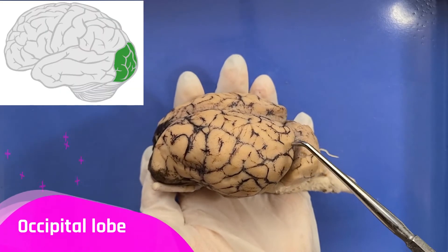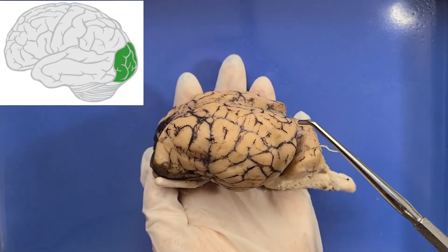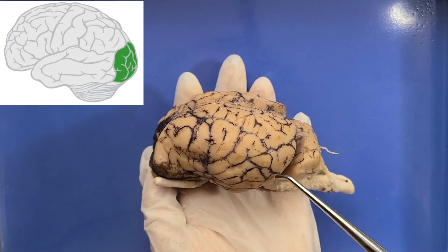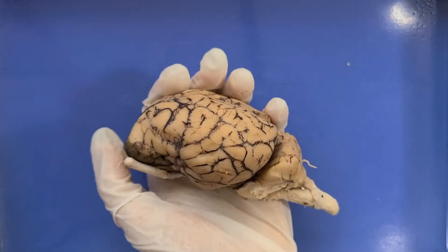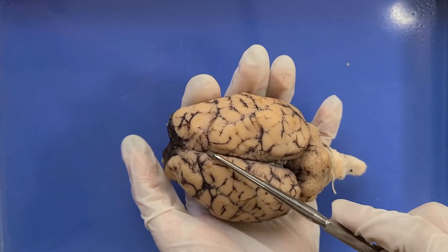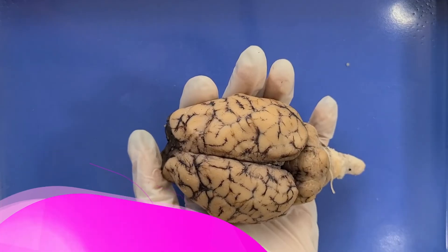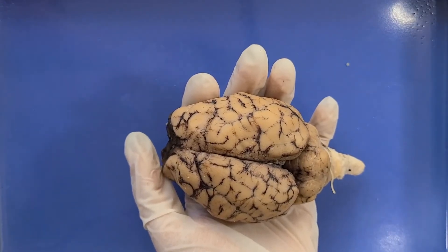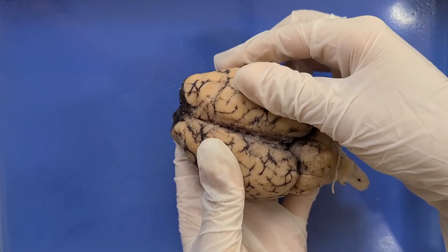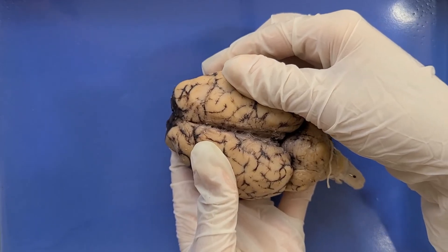This region in the back is the occipital lobe, which is involved in processing visual information. The optic nerves lead to the occipital lobe where information from the eyes gets interpreted and processed. This longitudinal fissure divides the brain into the two hemispheres — left and right. The hemispheres are held together by a large band of nerve fibers called the corpus callosum, which connects the left and right sides of the brain, allowing for communication between both hemispheres.